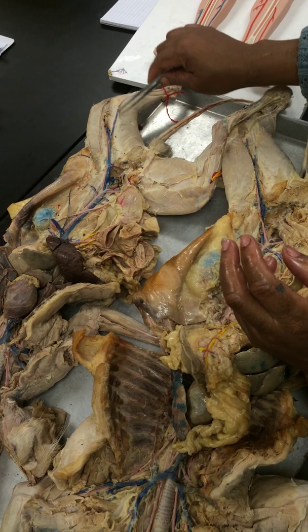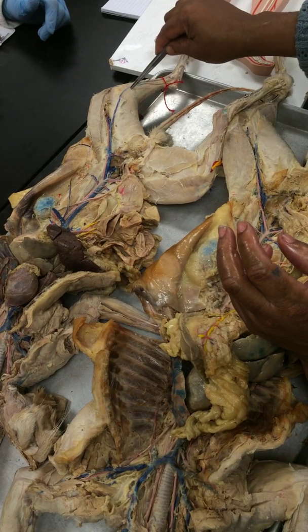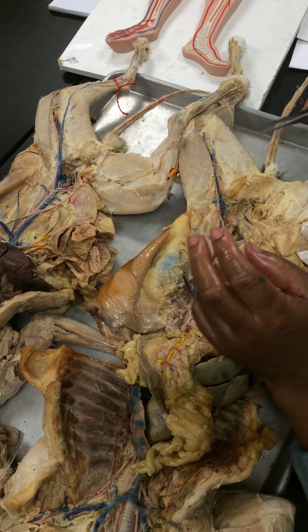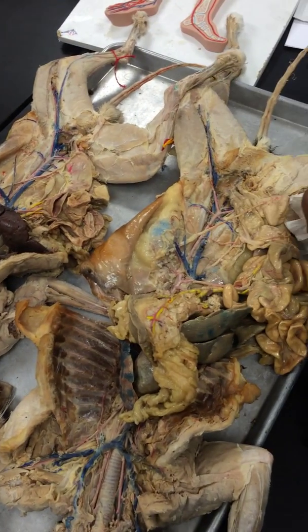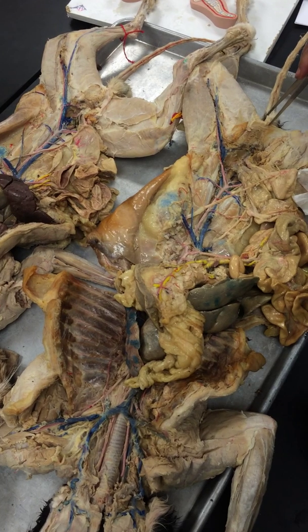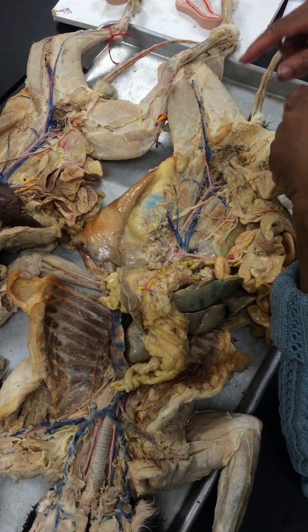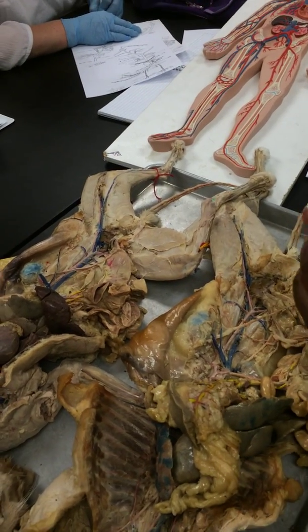Now you'll see this piece that's sitting on here. It's going all the way to your toe. That's your greater saphenous vein. You'll notice a little skinny red one running beside it. That's your saphenous artery. Notice the size of the artery compared to the vein. Because this is a surface vein, in fact you can see it along your leg there. Because it's a surface vessel, you can't afford to have such a big artery sitting so exposed. So you notice it's really skinny compared to the vein. And so they call it saphenous artery, and they call the vein greater saphenous vein.